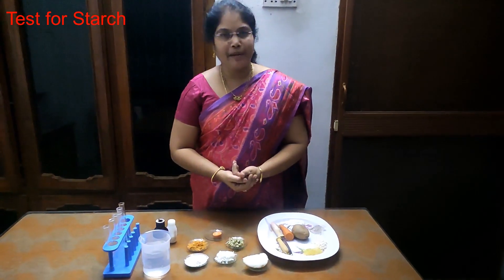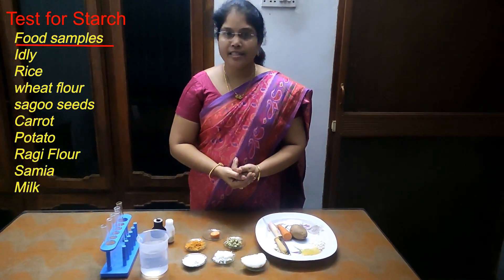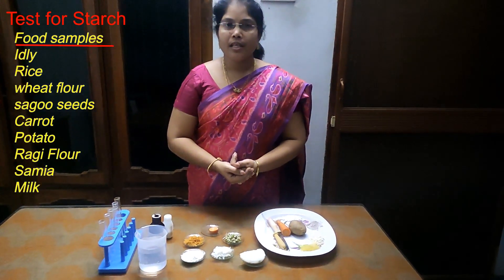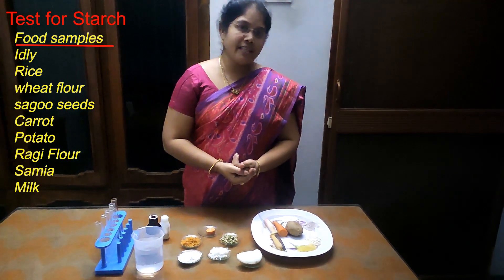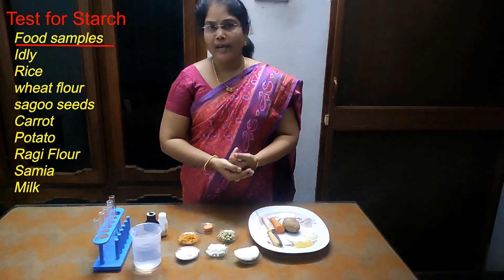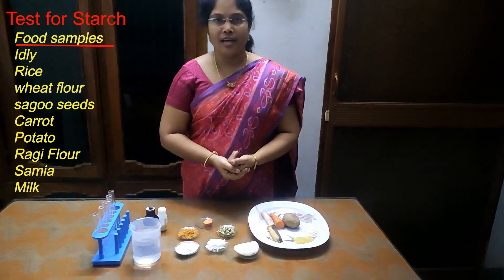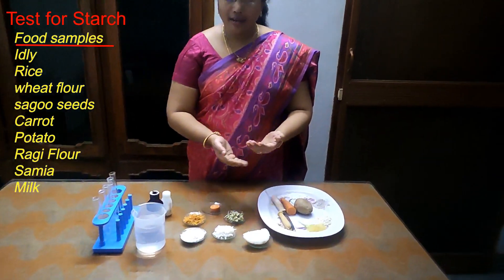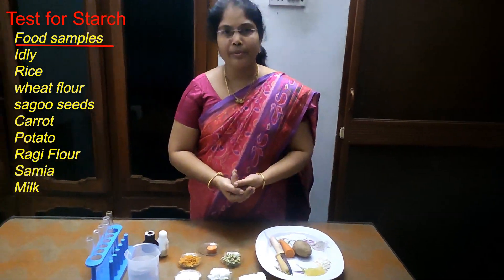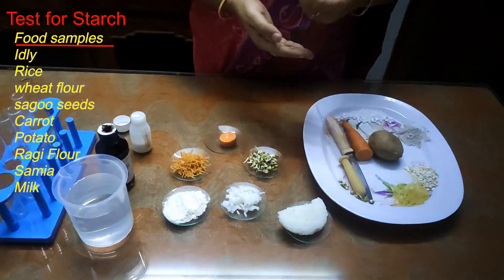Today I am going to explain about the starch test. Some food items contain starch in them. Let us check which food item contains starch. Here are some examples.